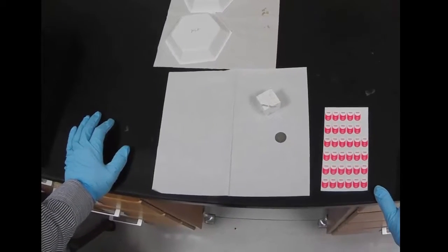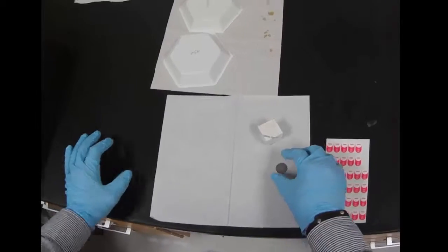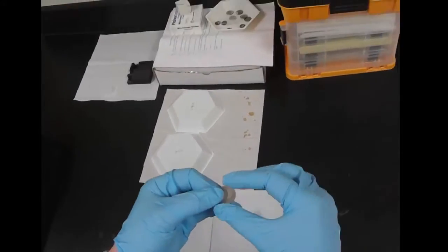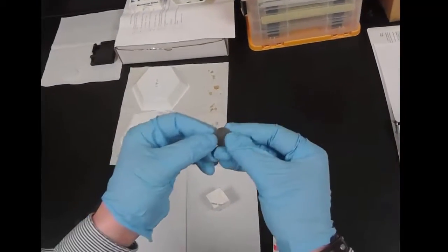To prepare your sample for the atomic force microscope, we need to get the sample holder ready. And it starts out as a steel disc.